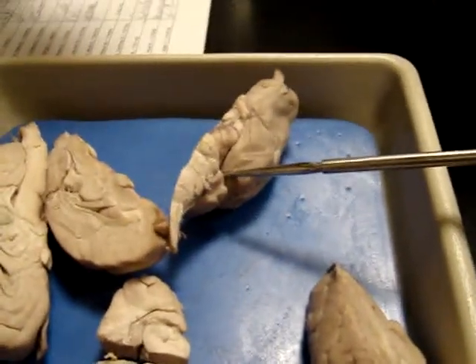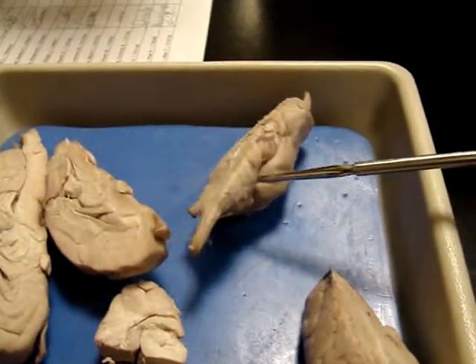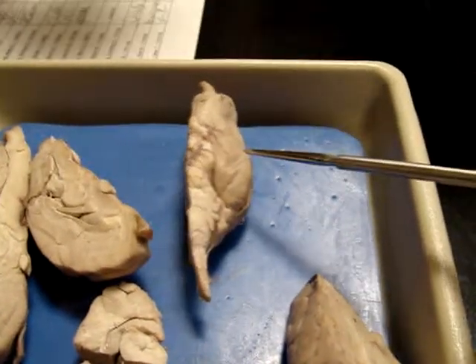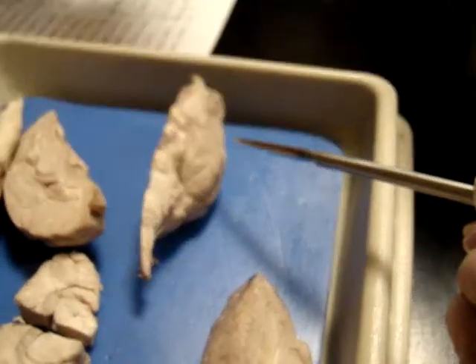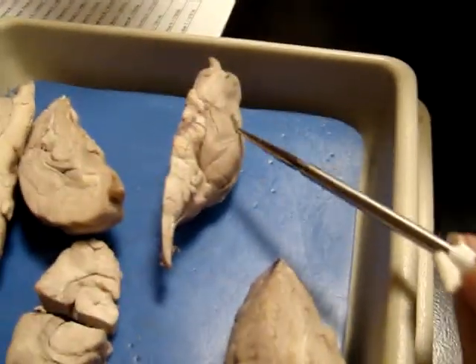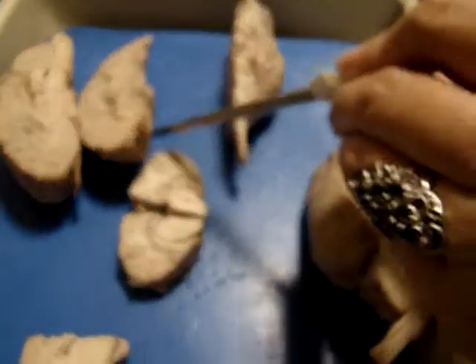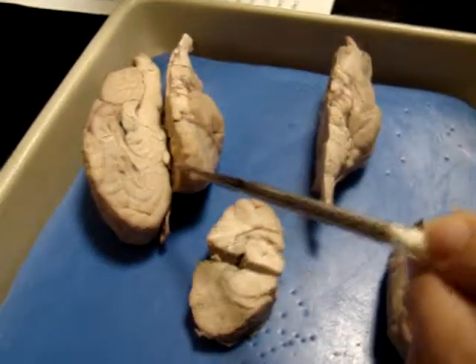This is a trick question. Where is the olfactory nerve? Olfactory nerve? There is one. That's actually the first nerve, cranial nerve 1. Where's the olfactory nerves? Is it that? This is the olfactory tract. This is the olfactory bulb. See, are these good too? Yeah, this is a really nice one too. You can see the tract. Oh, that's very clear. Olfactory tract, olfactory bulb.